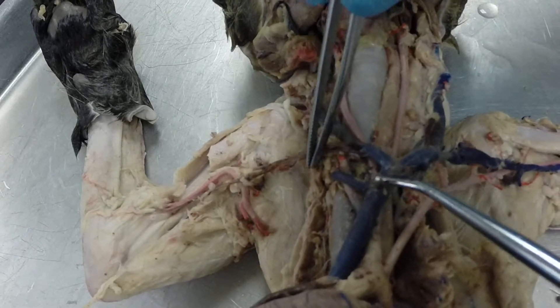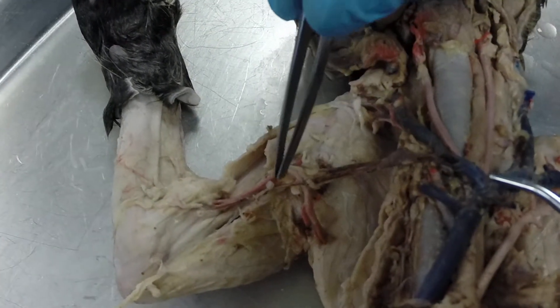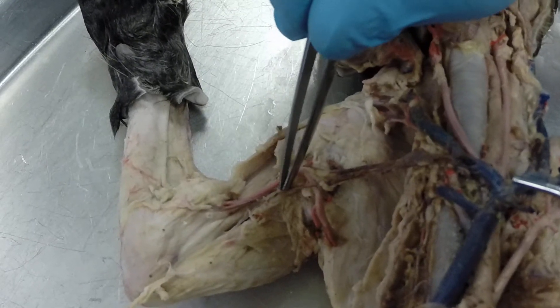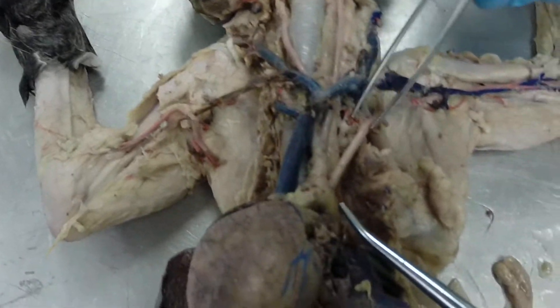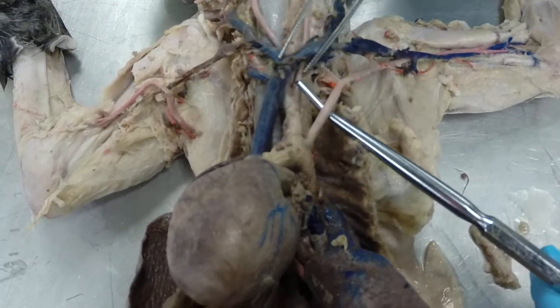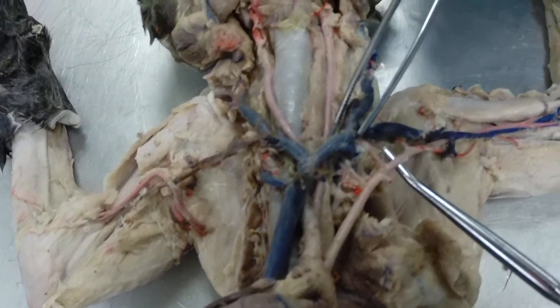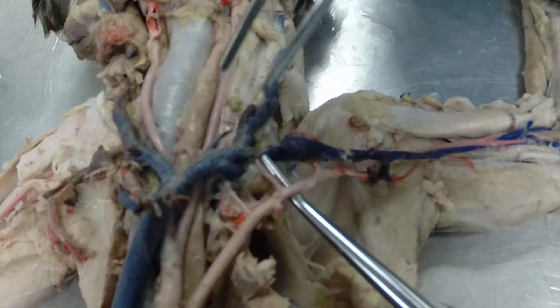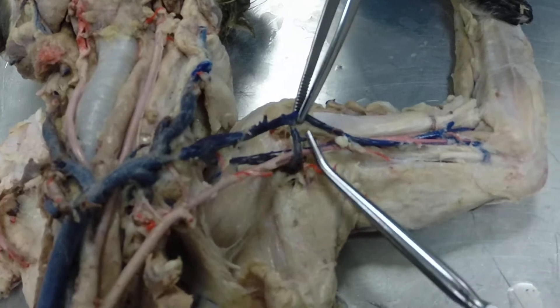When the right subclavian reaches the axillary region we call it the axillary artery, and where it goes across the arm we call it the brachial artery. Coming back to the aortic arch, our second branch off the aortic arch is the left subclavian artery. In the axillary region we call it the left axillary artery, and where it continues out across the arm we call it the left brachial artery.